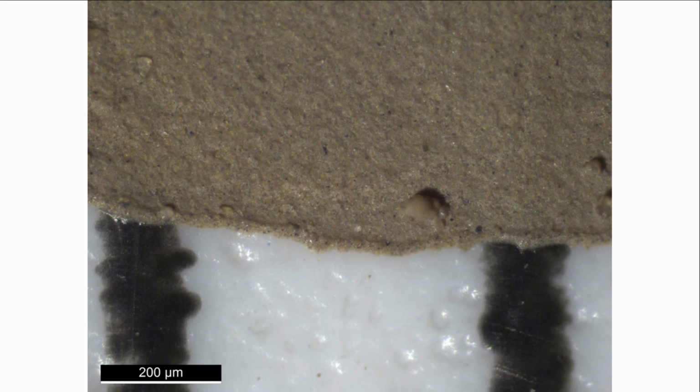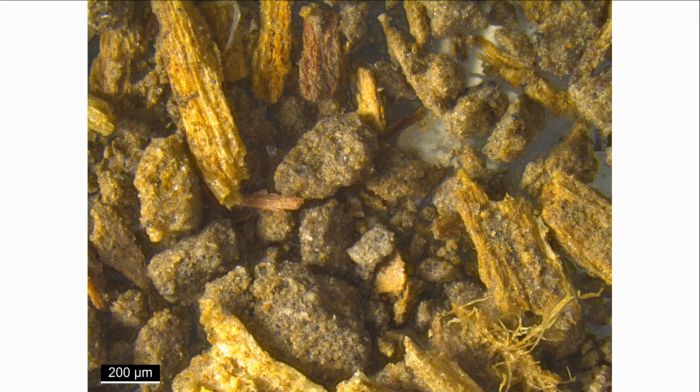If I take the same soil and stir it up in water, then let it settle for a minute, a drop of the dirty water is full of very small silt particles. The soil has very little clay, so the grains look clean, like beach sand. If we sieve out the small particles, we are left with aggregates and partially decomposed plant matter. We call this form of soil organic matter particulate organic matter.